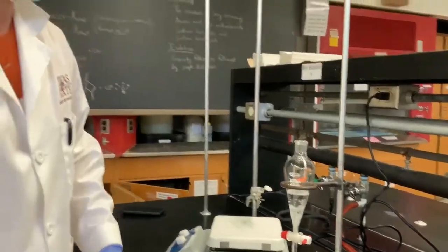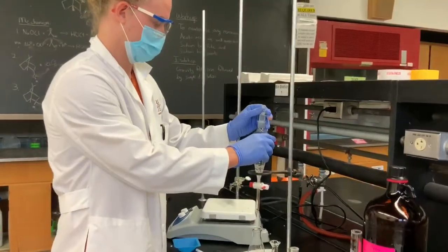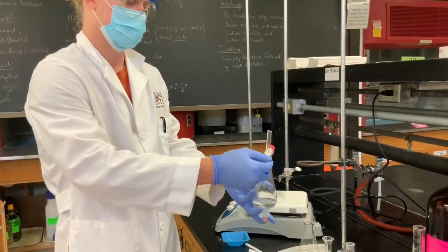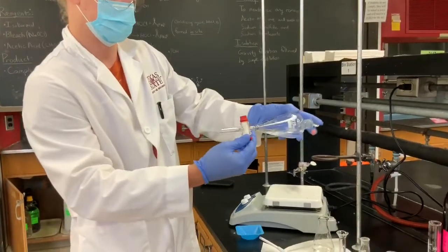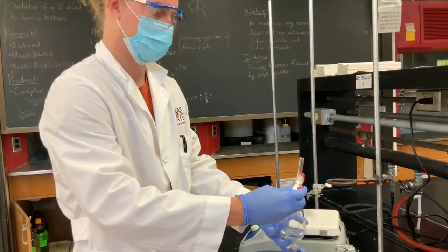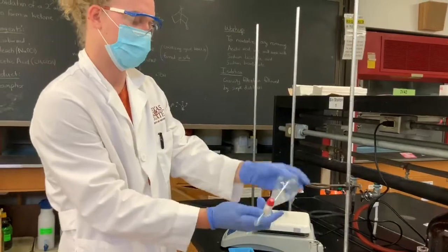That's the reason why venting is such an important step — if you build up too much pressure, this glassware can explode. Depending on what's inside, that can get all over you as well as all the glass. You have to be very careful at this stage. Removal of pressure is very important. Don't keep it in your face — it should be away from your face. Also, don't point it directly at your lab partner.